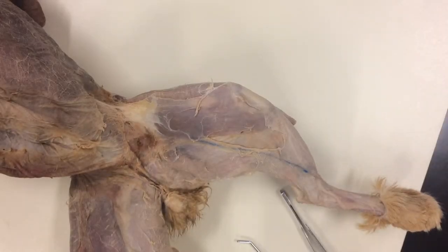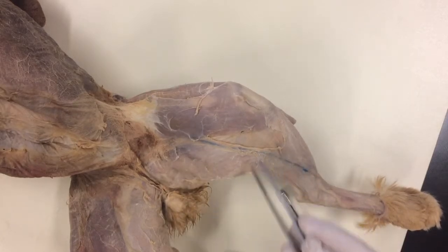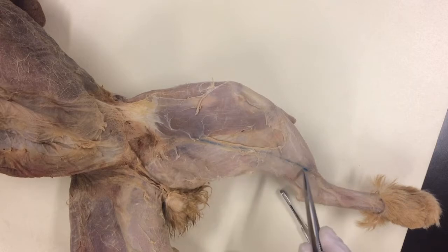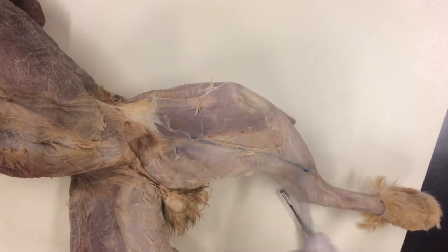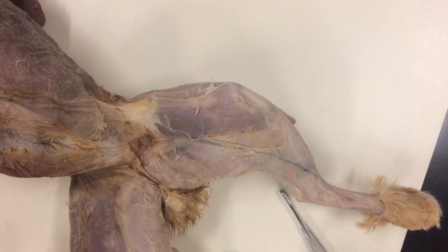In this video we're going to do the first two muscles of the medial thigh — Sartorius and Gracilis — and we're also going to do this major blood vessel. In this cat it's injected spectacularly. This is the Great Saphenous vein, and we're going to save that as it comes up into the femoral triangle. So we're going to do all that at one time.